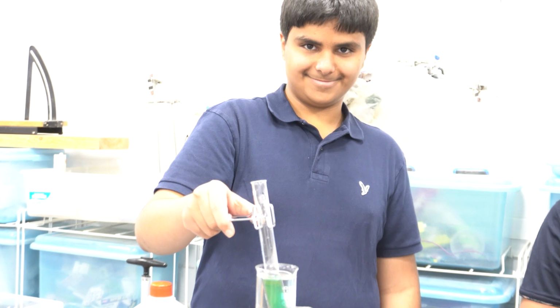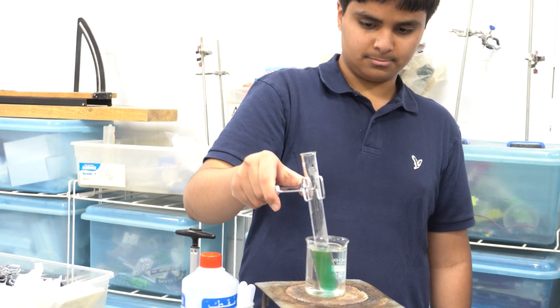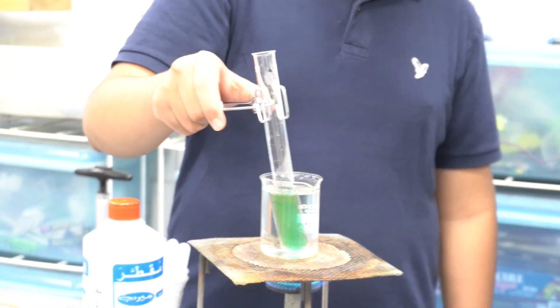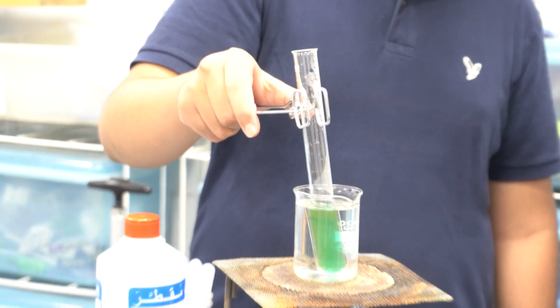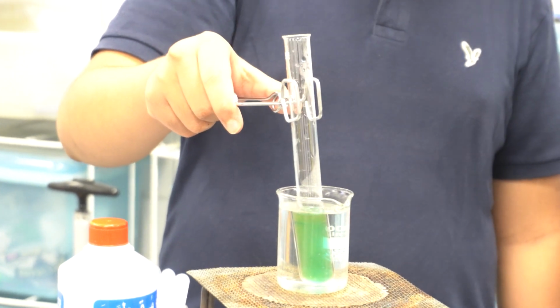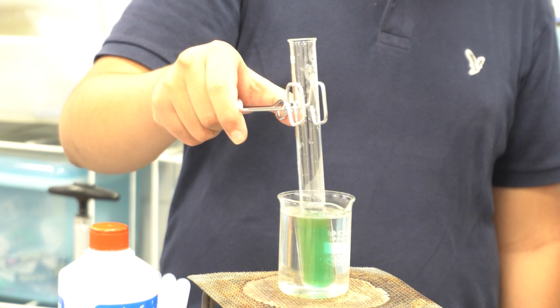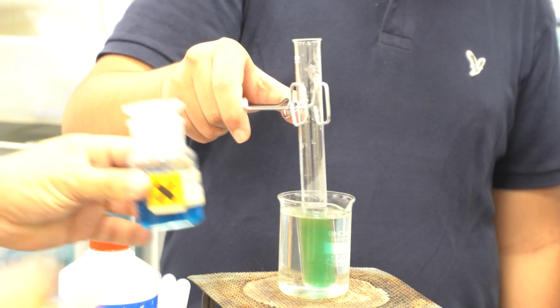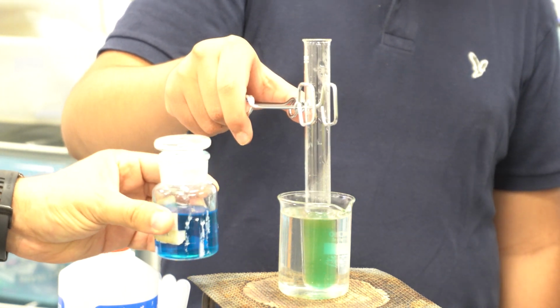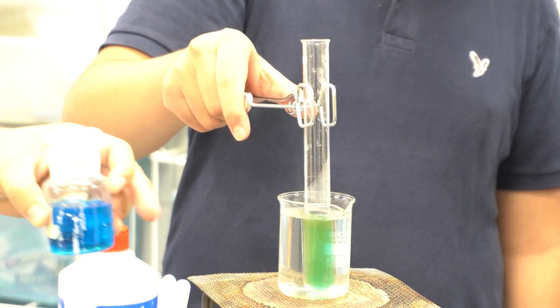Do you have a thermometer to see how much it's changed? If I focus more on the beaker, you will see that the color changes. It has started to change, and as you see, the normal color of the reagent is blue. This is the normal color that we added in the beginning, which is the Benedict reagent. It was blue, but now the color has started to change and now makes green.